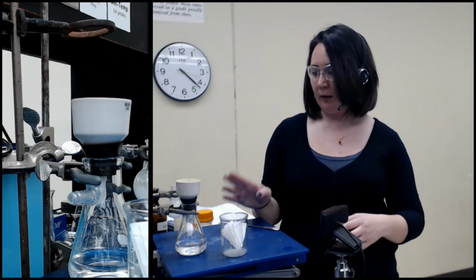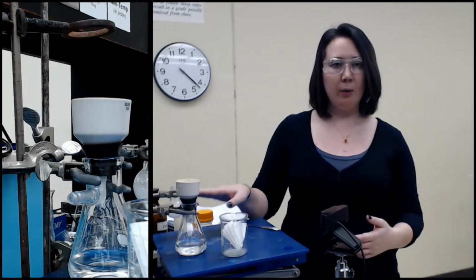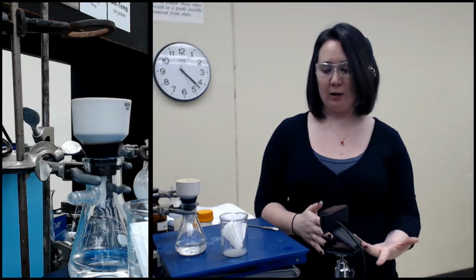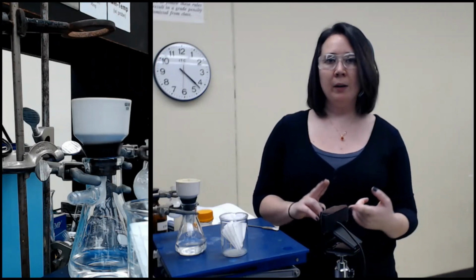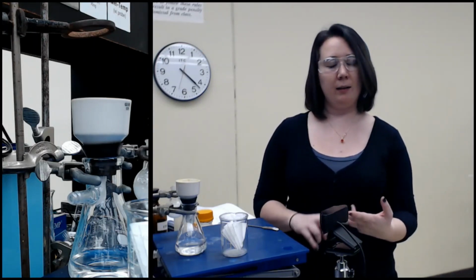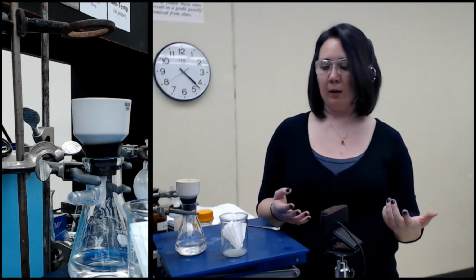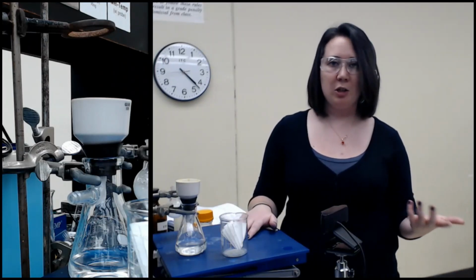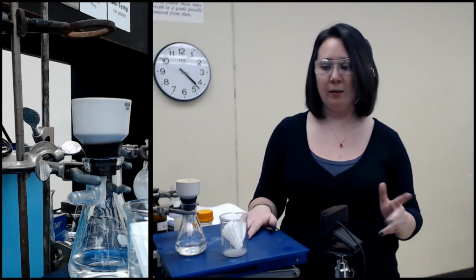You should also know what each one of these solids are. You've got the procedure and you've got the background for acid-base extraction, so you can determine what each of these were. Remember, our 3 options were sucrose, acetanilide, and acetylsalicylic acid. Each one of these should be 1, and the melting point is going to tell us if it is pure or not. I will present that data to you in a series of pictures and numbers. I'm not going to film myself doing the melting points or weighing them out tomorrow.